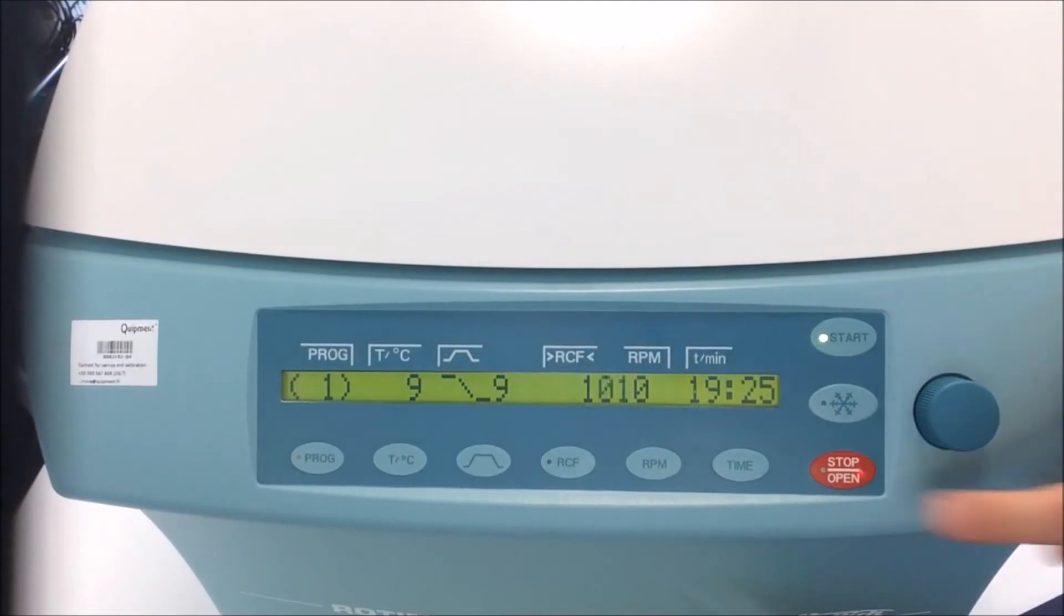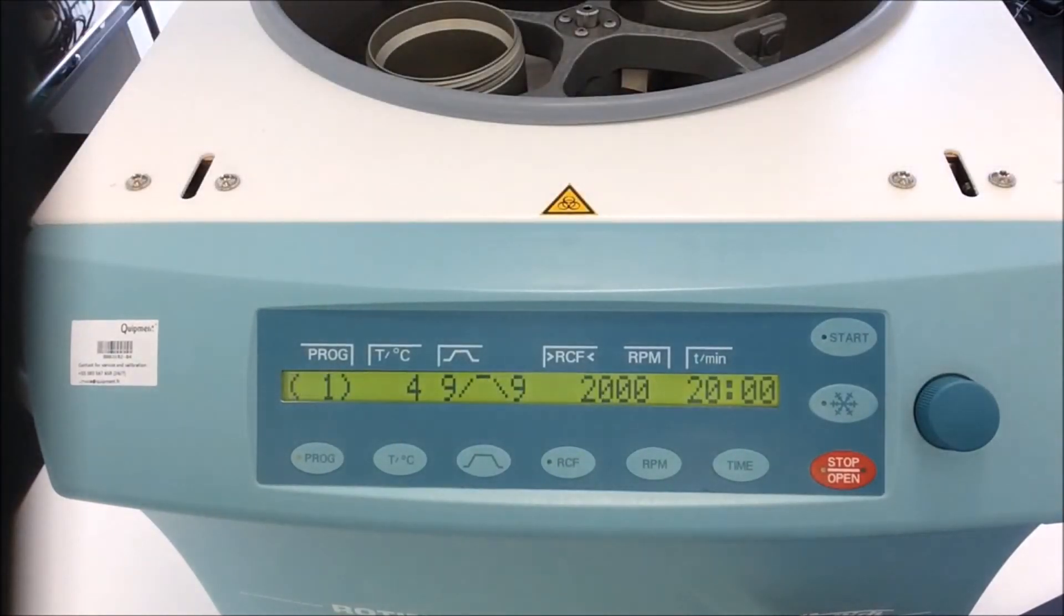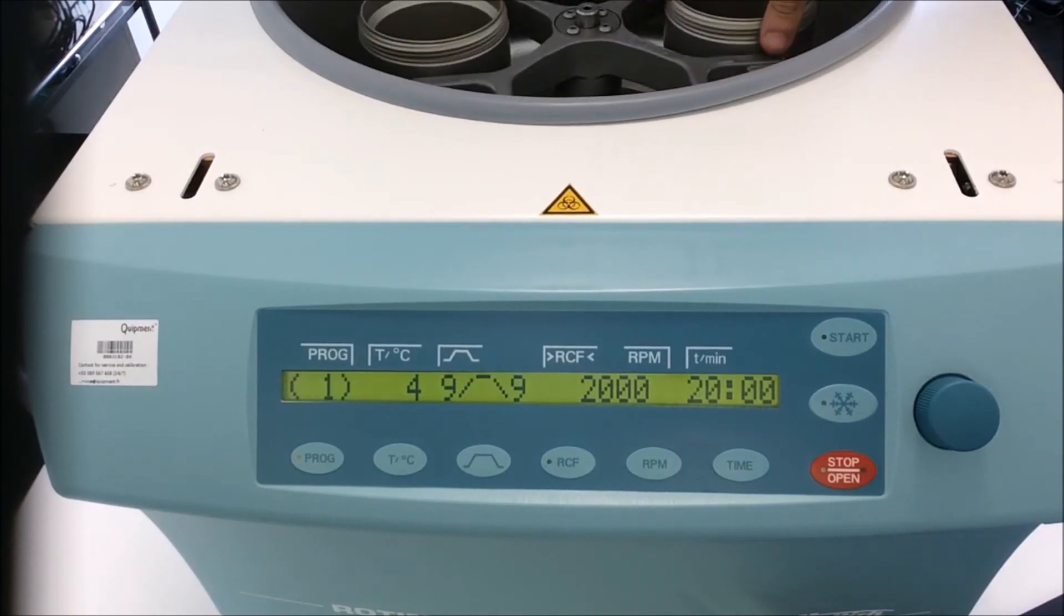Speed is decreasing. I cannot open the door until the speed is 0 for safety. Okay, now it's over, I can open it. And normally I should just take out my samples.